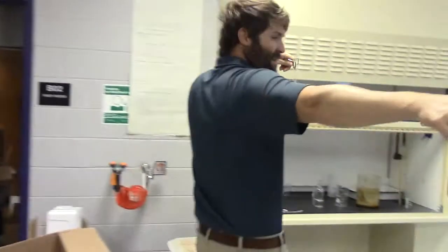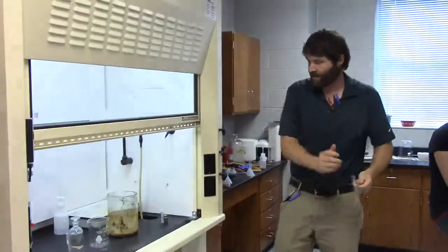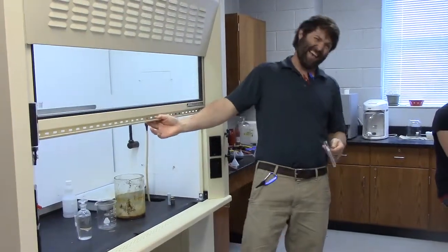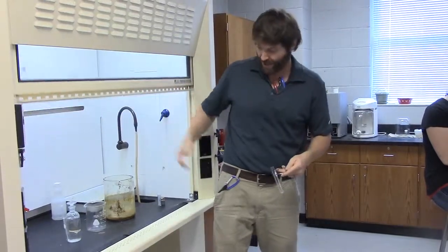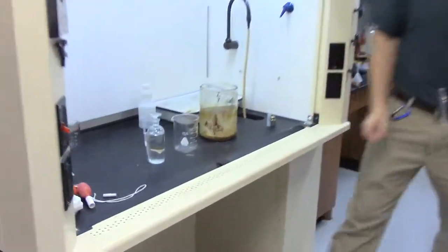I'm going to go over here to the hood. So, step number 1, get a little bit of every one of those samples of salt. Step number 2, I'm going to get some hydrochloric acid. Hood's getting turned on. I'm going to raise, theoretically, the sash ain't actually supposed to be over this tall, but for the sake of the video, we'll go ahead and raise it up. So, what I'm going to do is, here it is. It says 6 molar HCl.